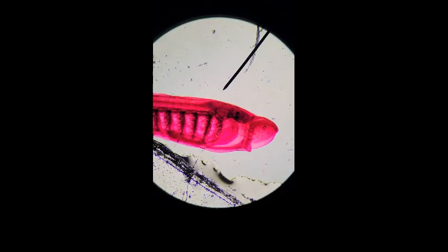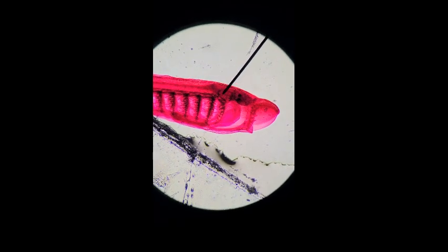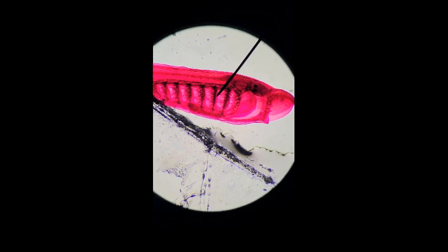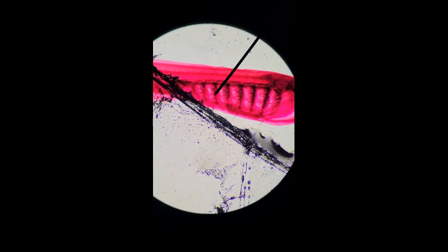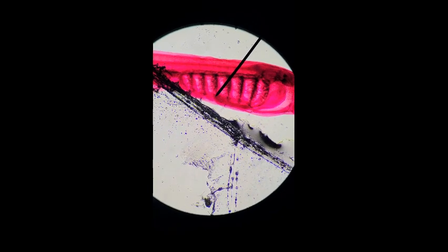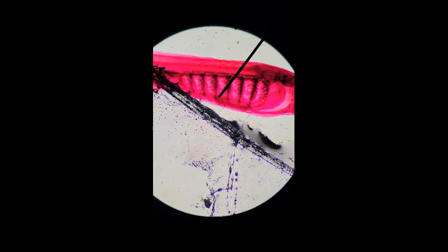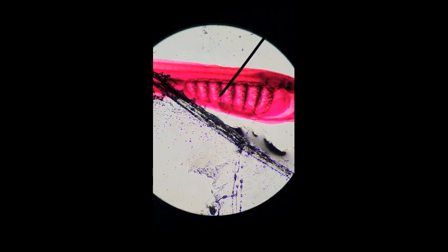This is our Ammocoetes specimen. The pharynx here draws water in across the gill filaments of the gill pouches and out through the external gill slits and pharyngeal slits. The subpharyngeal gland, this dark red one here, is likely homologous with the endostyle of the non-vertebrate chordates, and this lies ventral to the pharynx.